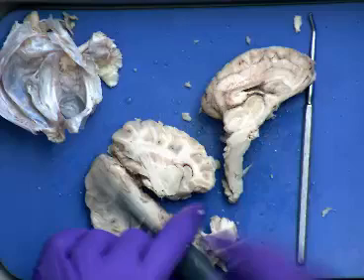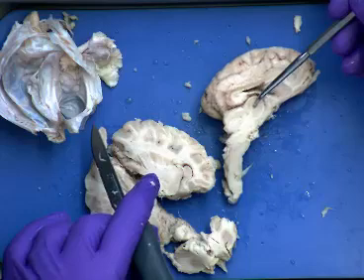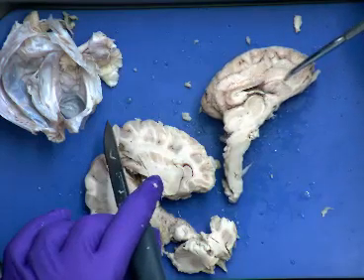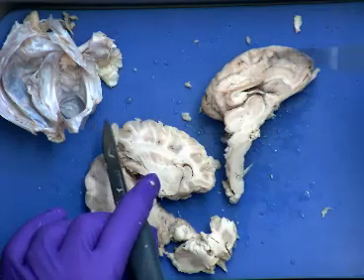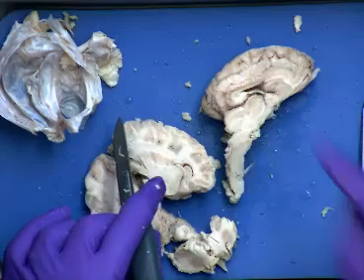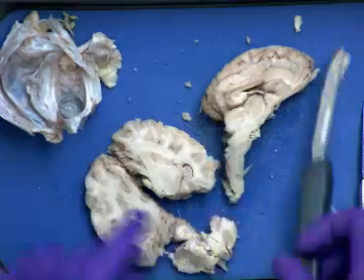So on the lab practical, we would expect that you would have a pin with a number on it. It might say, name this structure right here. That would be our thalamus. Or it might be name this white structure right here, or corpus callosum, or name this lobe, or something like that for frontal lobe, etc. So only the things that we have on the list from the handout would we be required to identify on the sheep brain on the lab practical. Okay? But it's a very straightforward dissection.